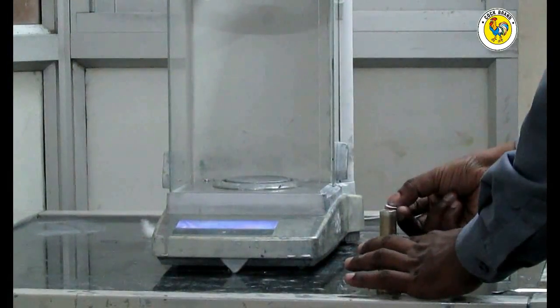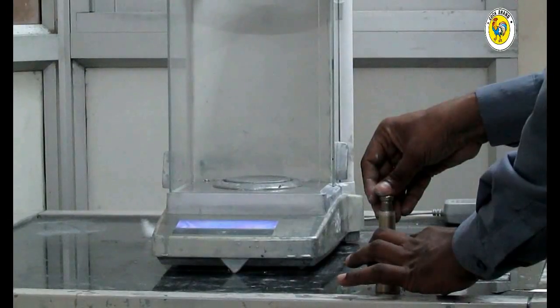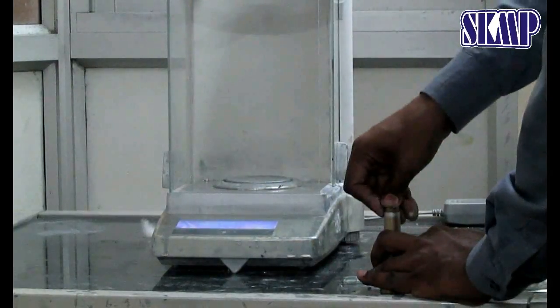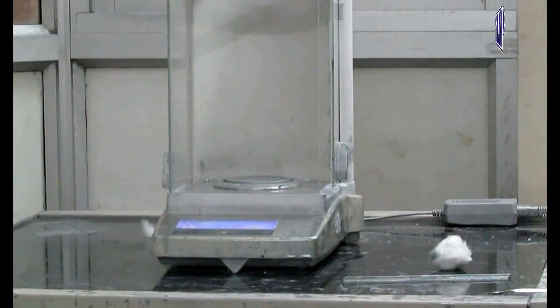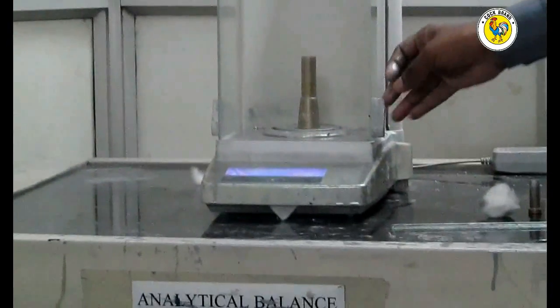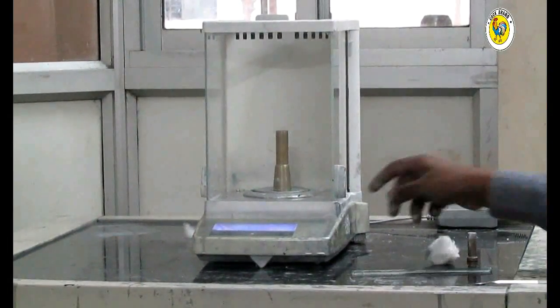Again I place the paper filter disc over the aluminium powder and insert the plunger to form a bed. The filling of aluminium powder is now complete. The weight of the sample taken is 1.1176g.